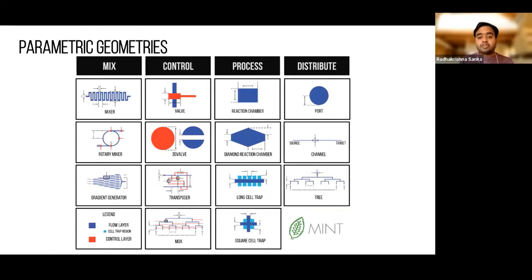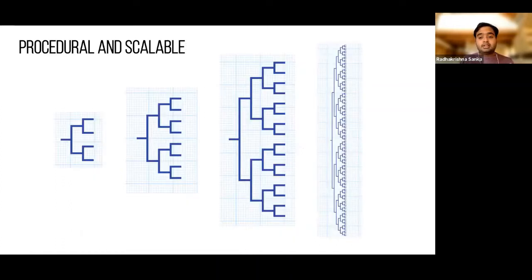So it's not just one of them. Every component we have inside 3DUF and every predefined component we have in 3DUF is a parametric geometry, which means that you can actually vary all kinds of things in these geometries and figure out how they're generated. And the other thing is that because they're all parametric, it means that we can use algorithms to procedurally generate them. For example, for anyone who's drawn trees in AutoCAD, they will probably know how painful it is. I've tried doing it and I gave up after the first 10 minutes.